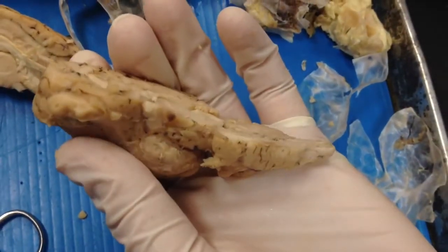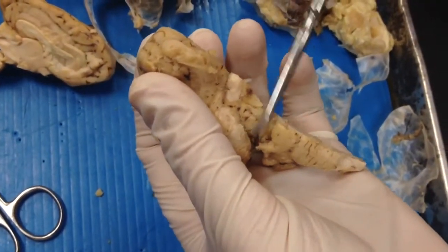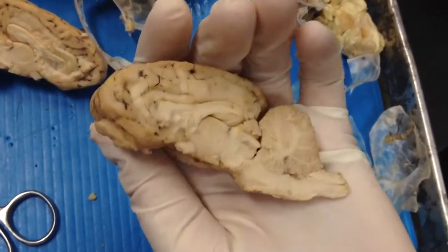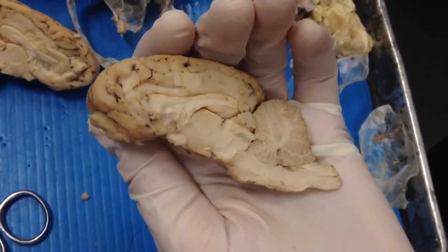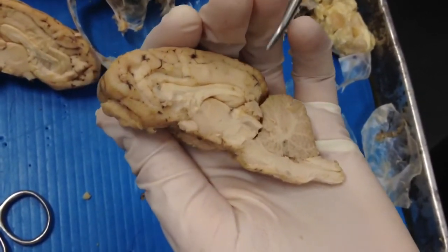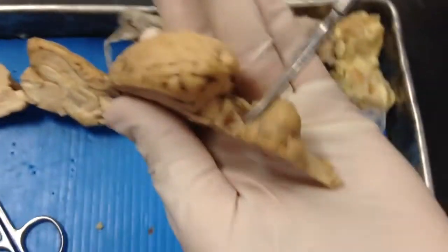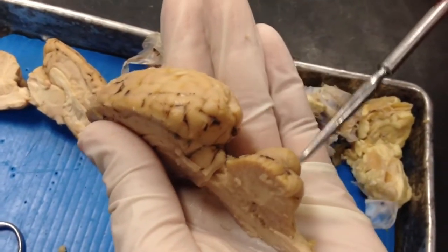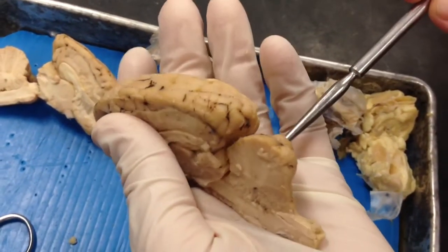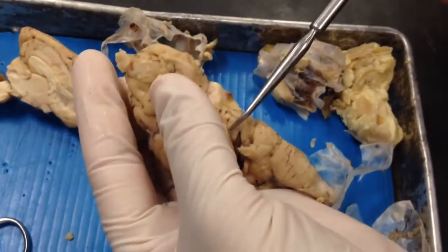The mesencephalon is the midbrain — it's right here. The corpora quadrigemina are the colliculi: here's the superior colliculi and the inferior colliculi. And the cerebral peduncles are right here.